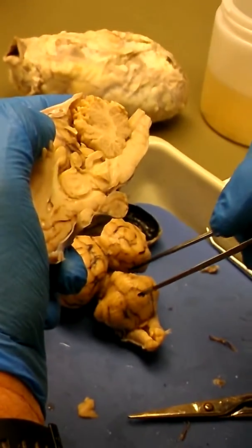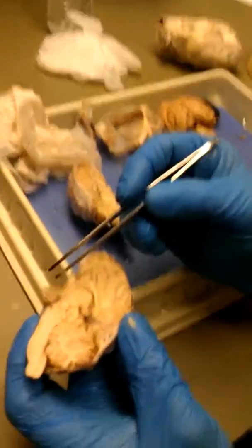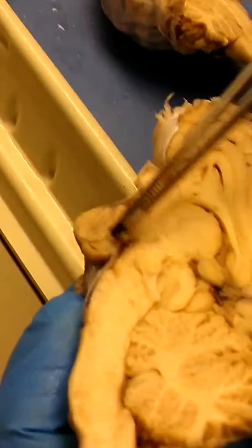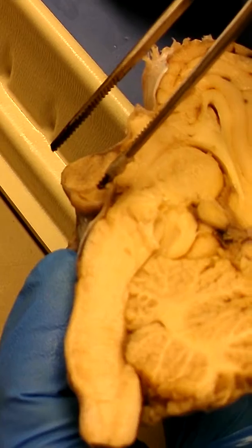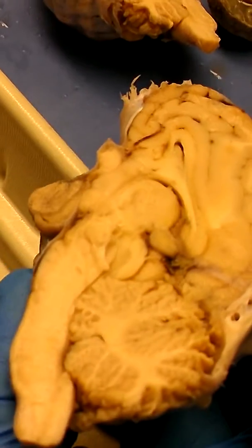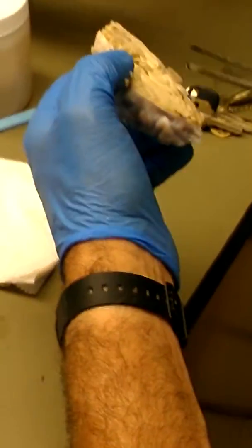Wow. Wow. Okay, this is a great pituitary cut. It looks like a pear, and there's two pieces. There's one in the front and one in the back. That is the anterior and the posterior pituitary, and I've probably only seen that 3 times on a cut. And it's amazing that it came out like this. So somebody hacked this in half, and they got the anterior and posterior pituitary, and you can see them.